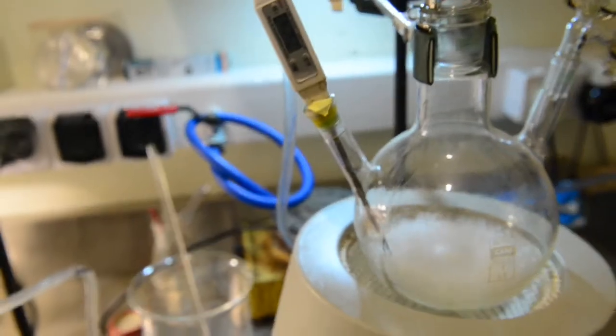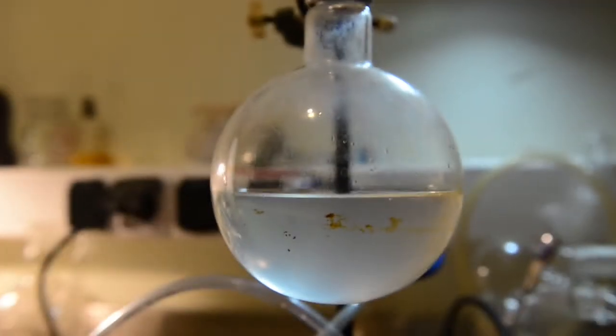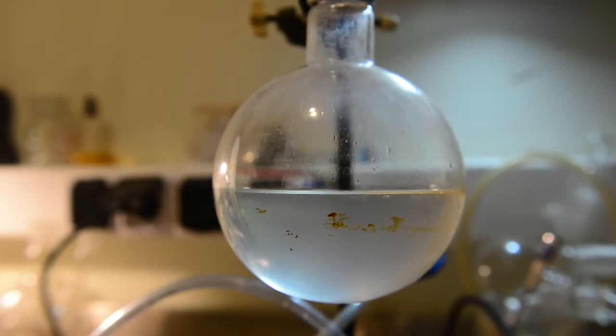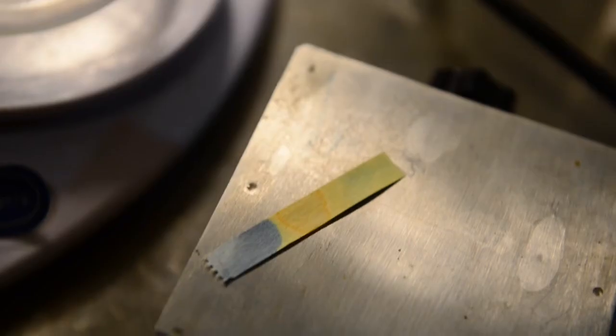After all three runs were completed, you can see the little amount of residue left in the flask. It is slightly yellow, with greenish tint viscous liquid. Almost 500 milliliters cloudy distillate was collected. We have placed the collected liquid to a large 2-liter 3-neck and we are ready to proceed with our workup.